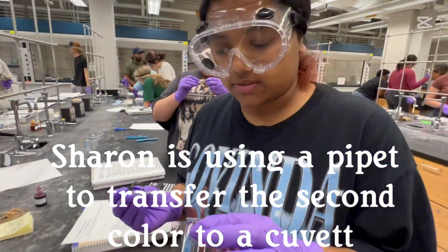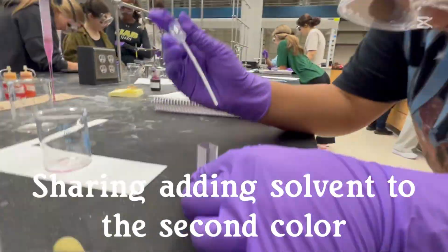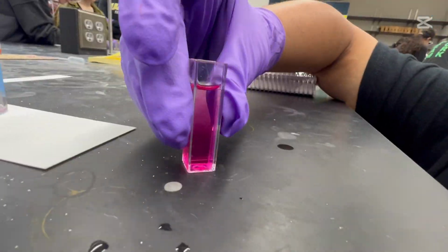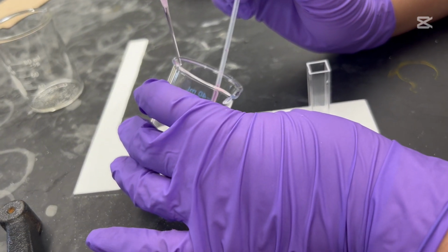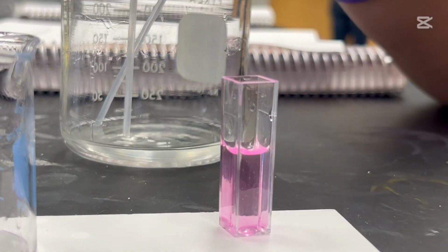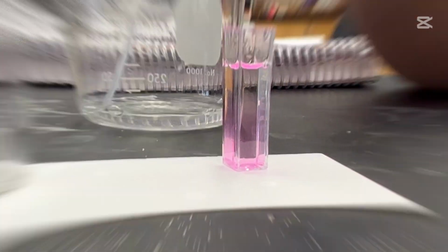Now we have our second color, so I'm just going to put this. The meniscus is touching the line.